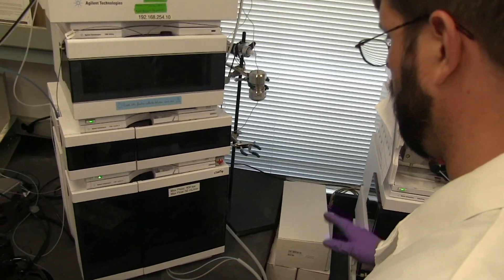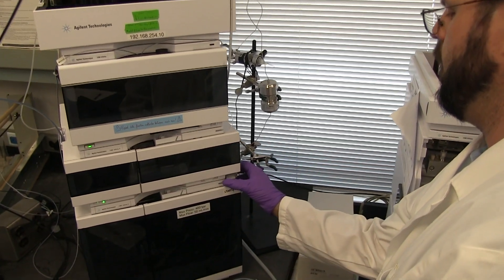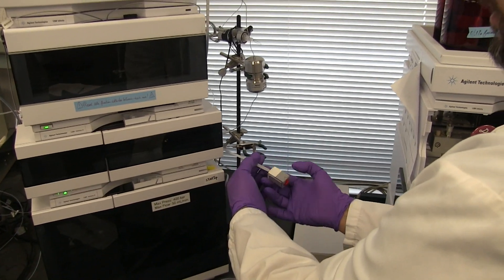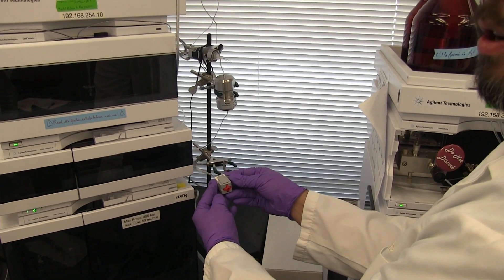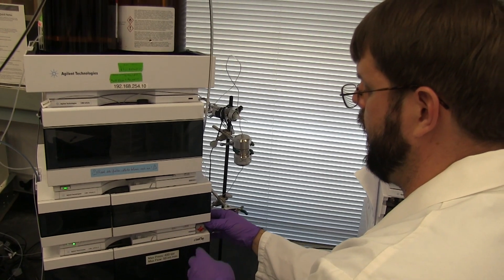Now that the methods are running in the software, we're ready to inject our sample onto the HPLC. Here you'll see the hard start button that controls the beginning of the fraction collector run. We just have this taped to the front of the HPLC so it's easy to access.